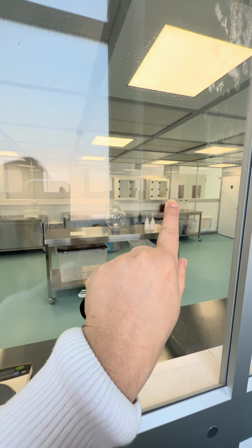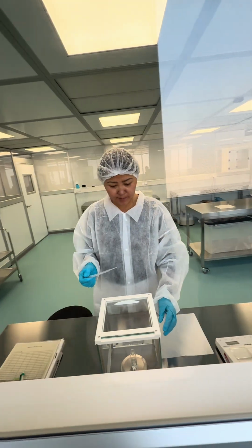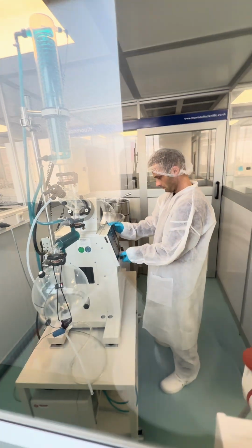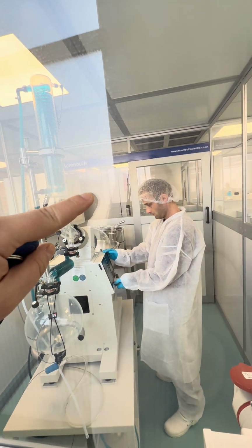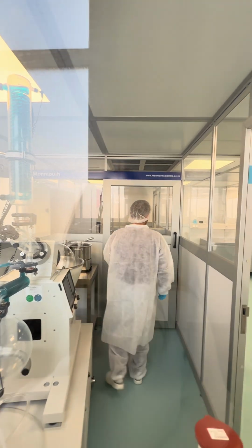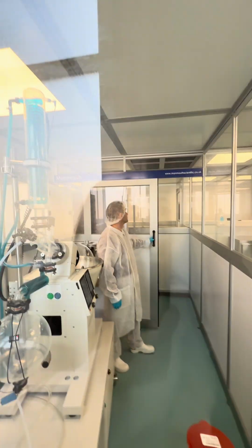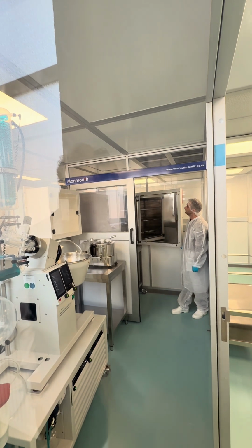Inside, the production area has 2 airlocks, 1 and 2. These are dedicated to end material and to trash. The room inside has a small clean room, a smaller divided area for the rotavap and for the oven that is in another part. Now I can show you the other part better. So here is the oven.